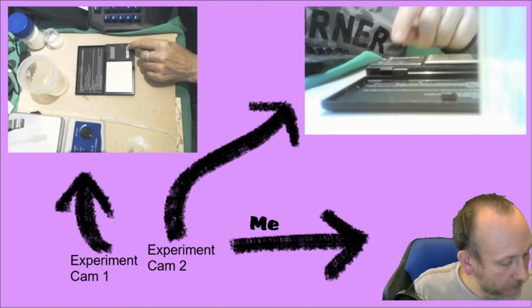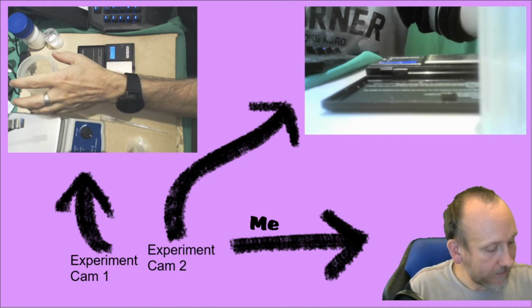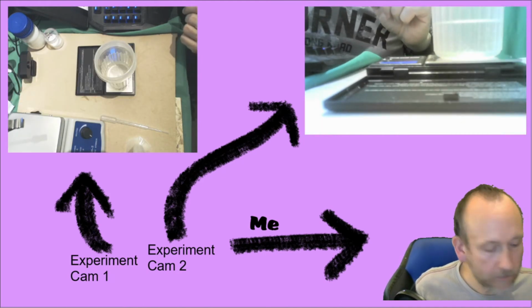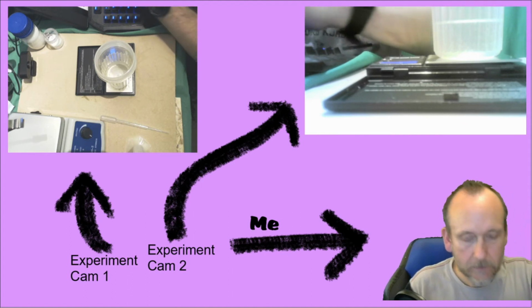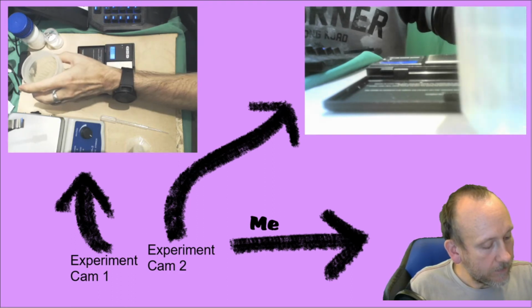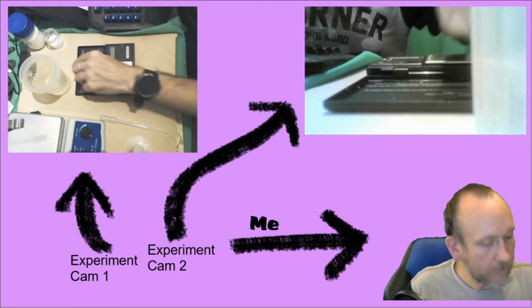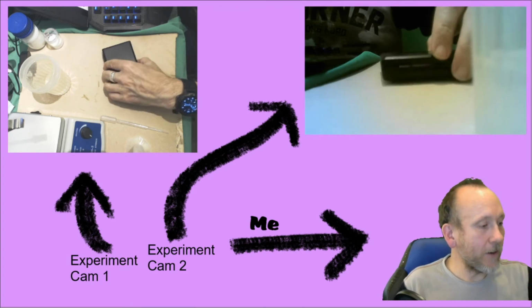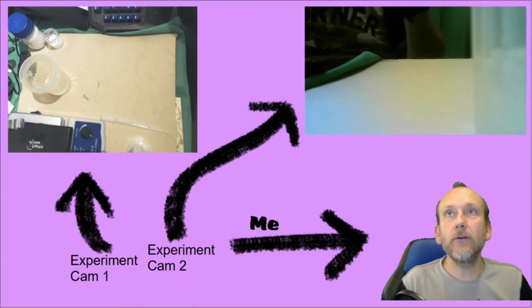So I'm going to now measure this again, weigh this. 117.56. Okay, 117.56. Okay, so experiment over. Now we've got to analyze it.